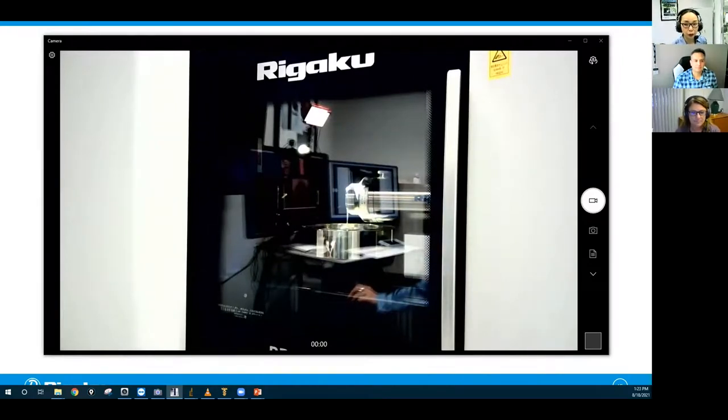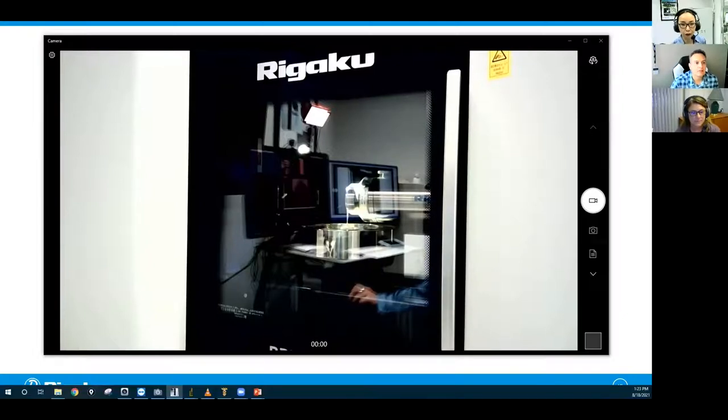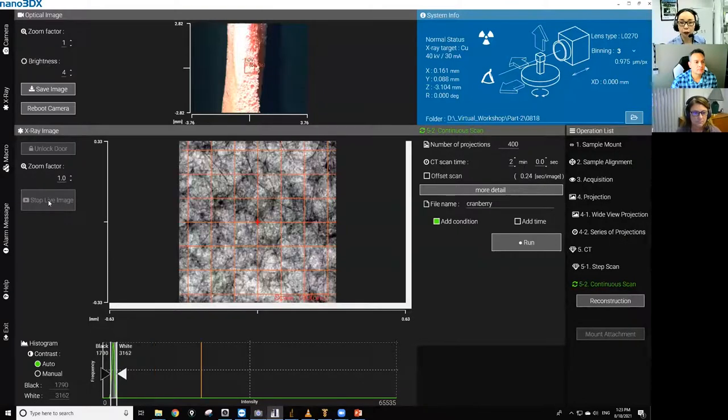Okay, so you're seeing the data collection view yet? Not yet. Camera view. There you go. Okay. So at the top, you see the part of the foam. By the way, this is taken from an earplug. And this is the one, if you saw Tom's LinkedIn post, that scan came from this sample.